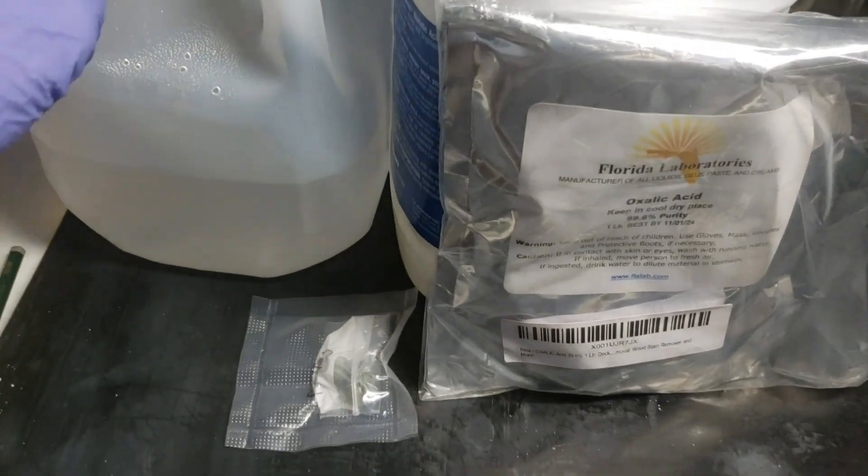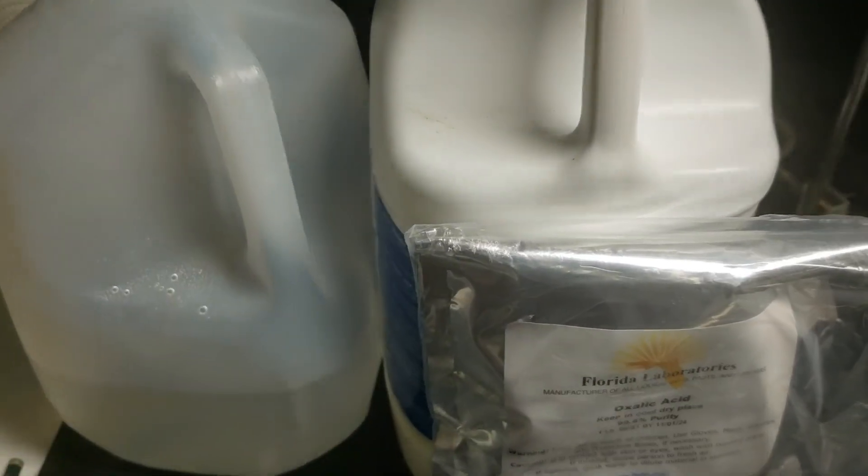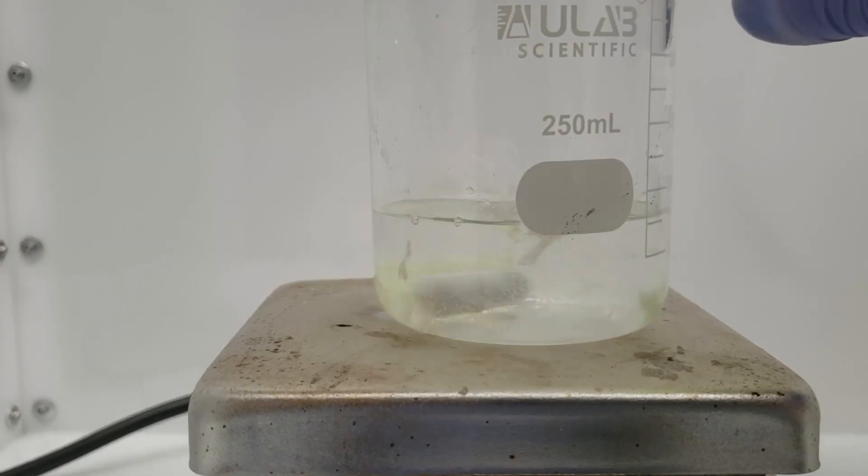You will need distilled water, Praseodymium metal, oxalic acid, and hydrochloric acid. So without further ado, let's get into it.